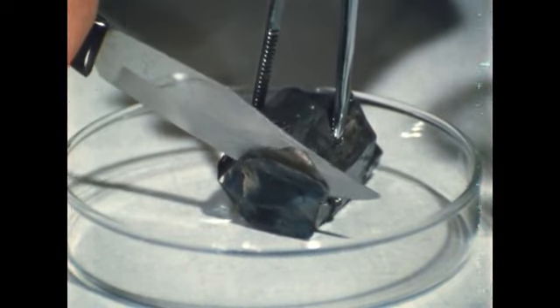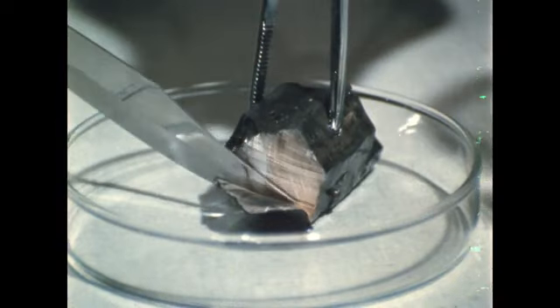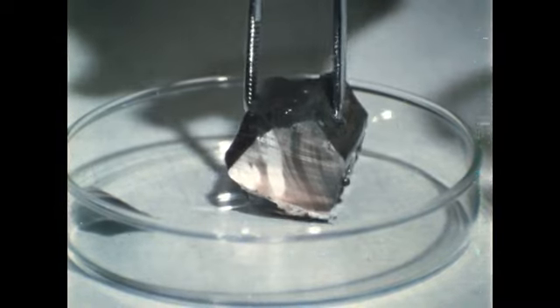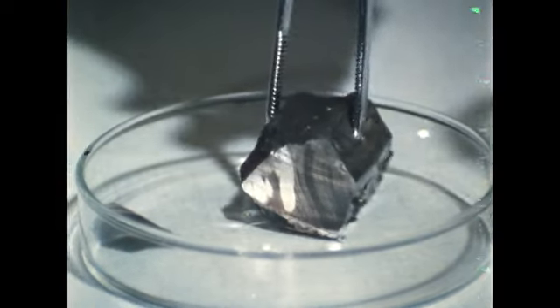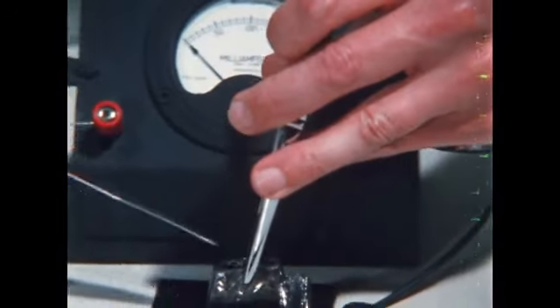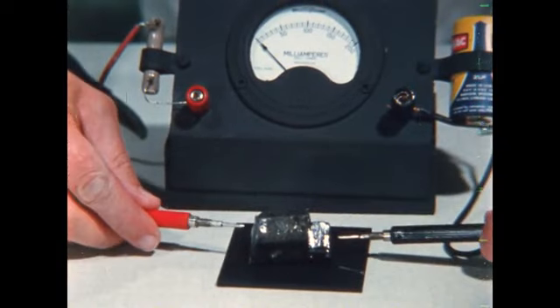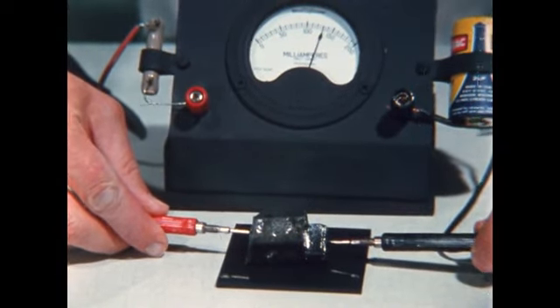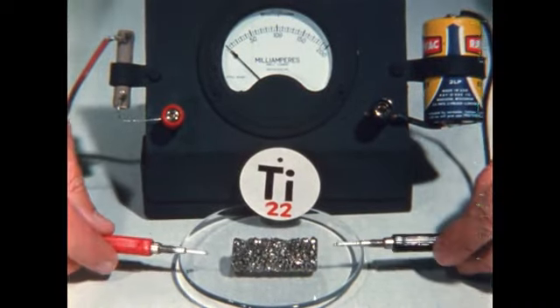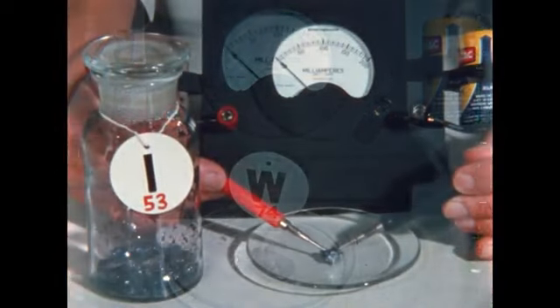Lithium is somewhat ductile and looks metallic. The clean surface, like that of potassium, reacts with air. The lithium turns black except where covered with oil. The shininess and ductility of lithium indicate that it is a metal and should conduct. It does. We proceed with the task of sorting elements into metals and nonmetals. Some conduct, and some do not.